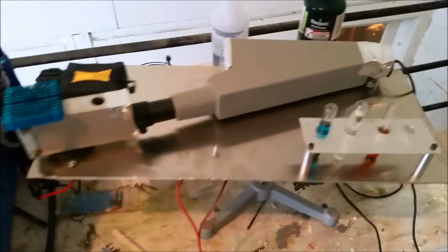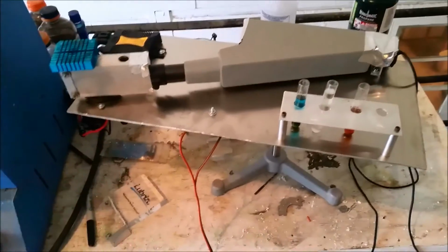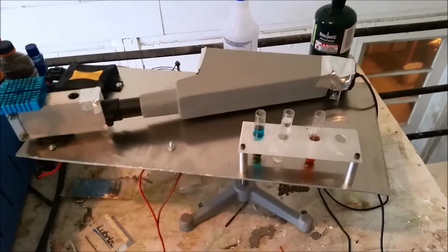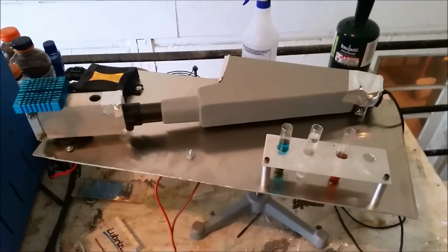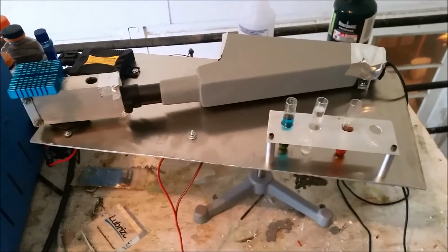I don't know if that is the way all xenon headlights are made, or if it's because I bought cheap Chinese knockoffs. But either way, I need to look into getting a proper bulb. I'm going to go ahead and get this hooked up to my computer and show you guys what the spectra that comes from this looks like.